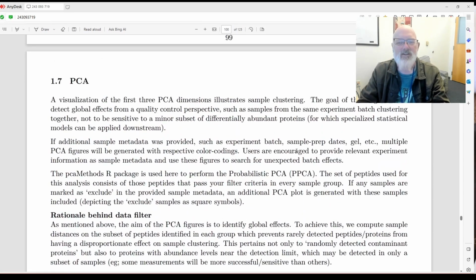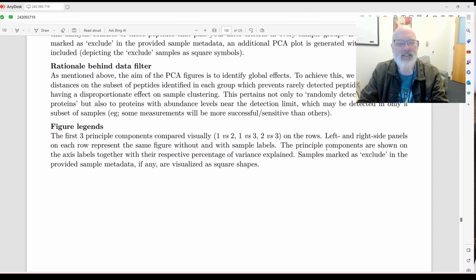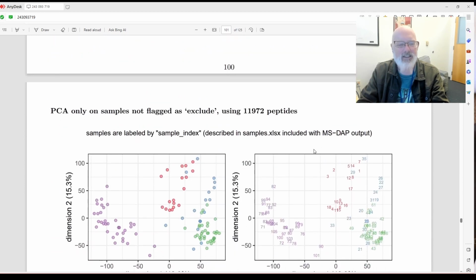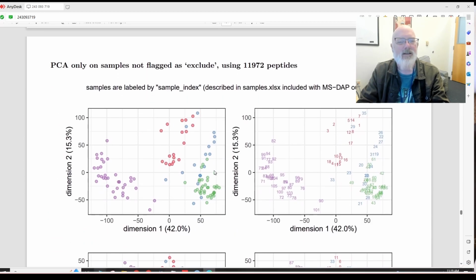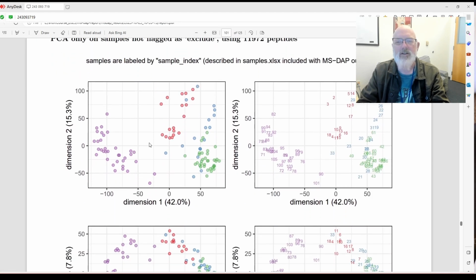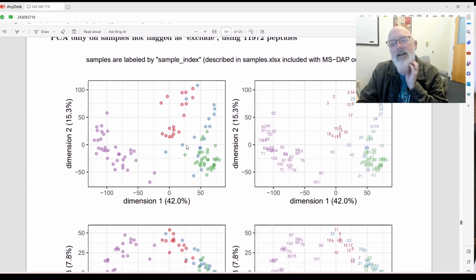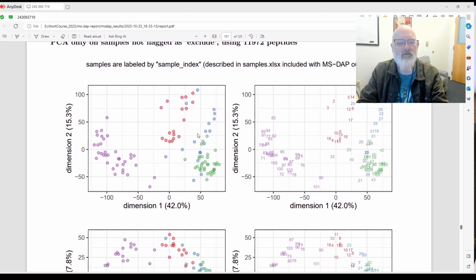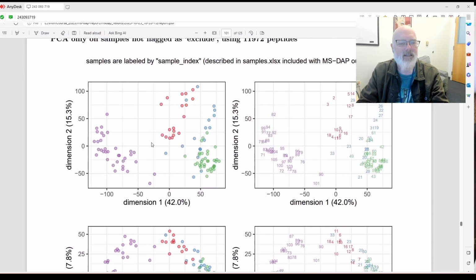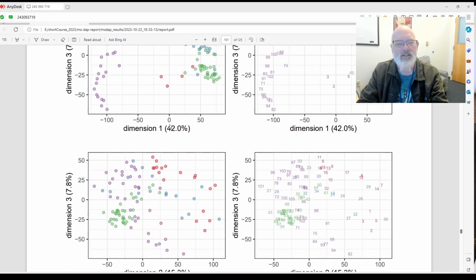All right, so here's the PCA. We kind of know what PCA is. It's a dimensionality reduction that lets us visualize the samples. We all know what PCA is. What is the color coding here? This is probably the different groups, and they should all color code correctly. Okay, or they should all group more or less based on the digest they used. You can see some are tighter than others.